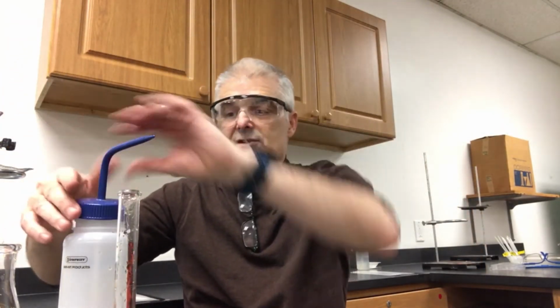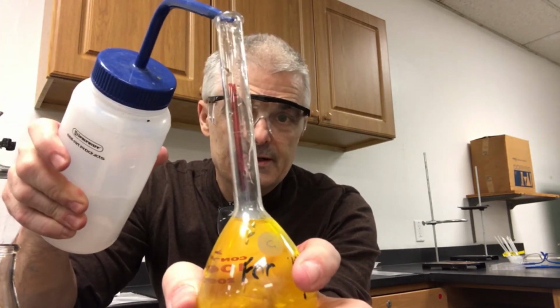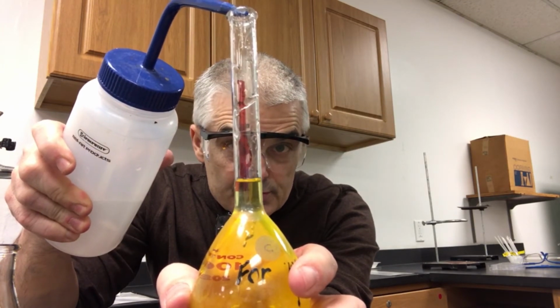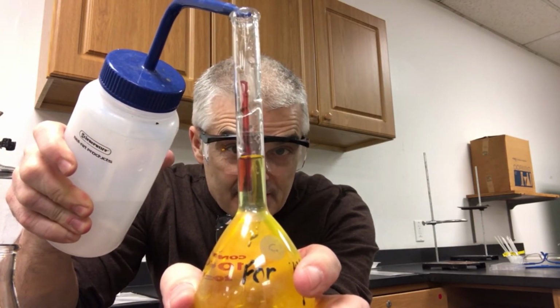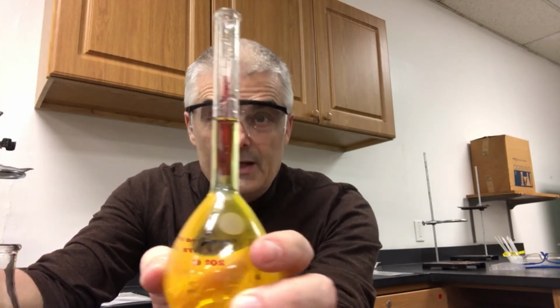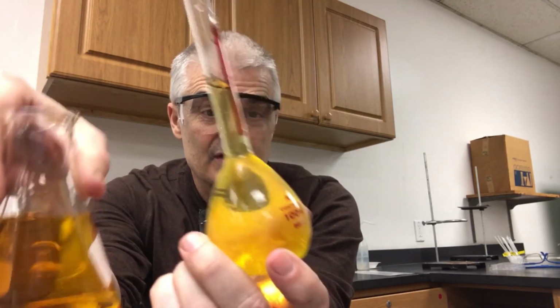So now I'm going to take the squirt bottle and squirt it right to the line. I'm going to go super slow, super slow, super slow. And I want to stop at the line. Boom. Now, if you take a look, we have the dark solution and we have the light solution.